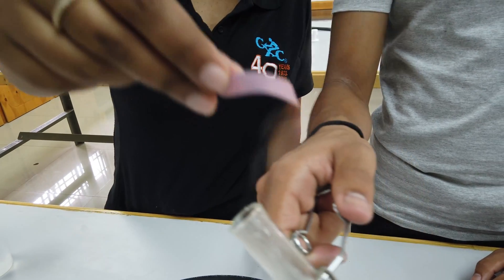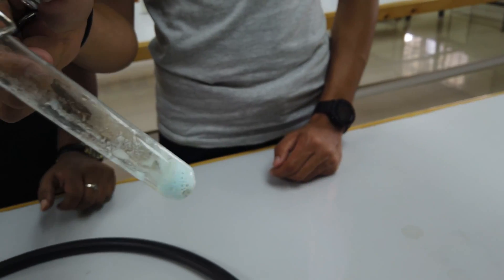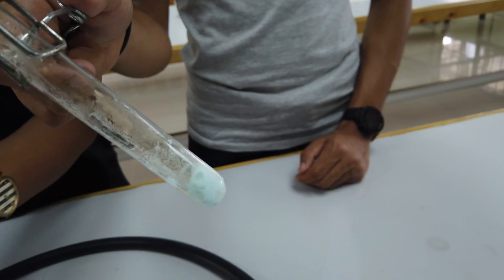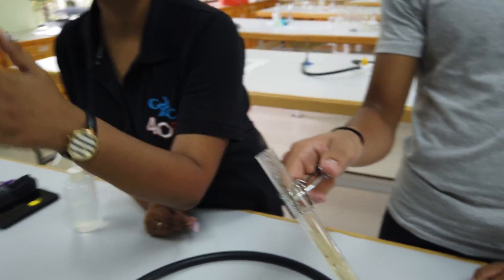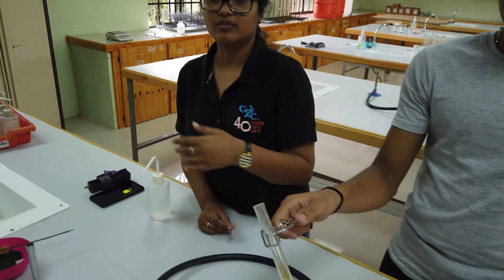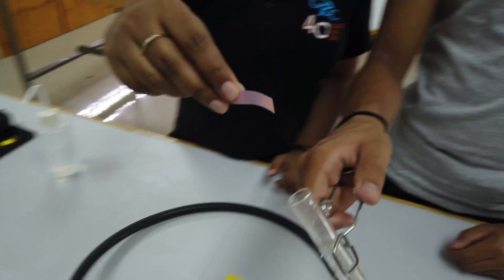If we're very quiet, you can actually hear a pop pop pop that's happening in the test tube. Now if you don't mind your business when you're doing this test, that solution could jump out of the test tube. And if your lab partner is standing here, it's going to come up into their face. We don't want that to happen. You are all very pretty children.